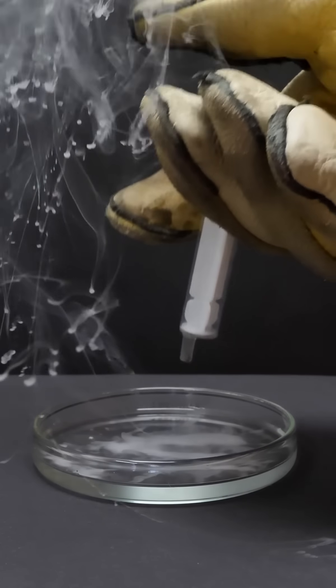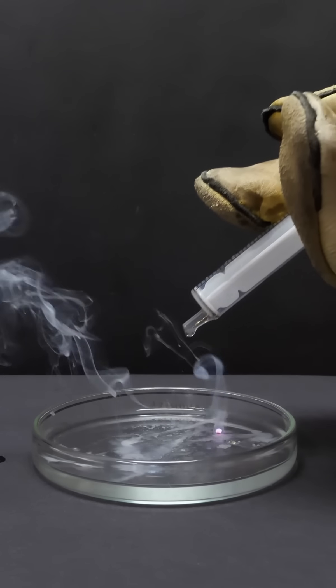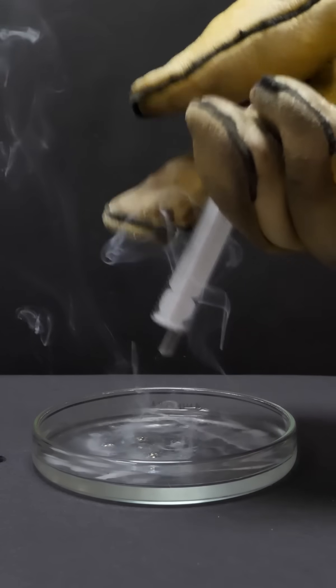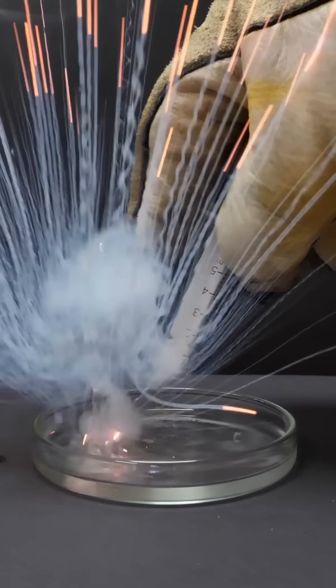As soon as the cesium touches the water, small purple fireballs begin to form. So far, these are only small drops, and even these are sufficient to trigger a significant explosion.